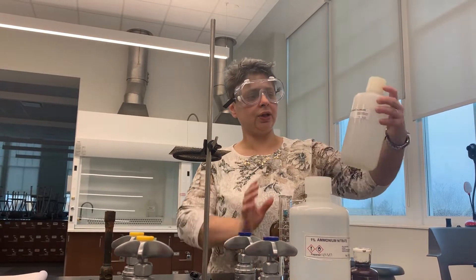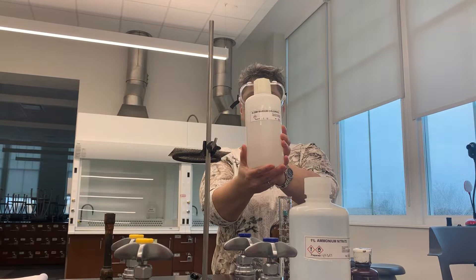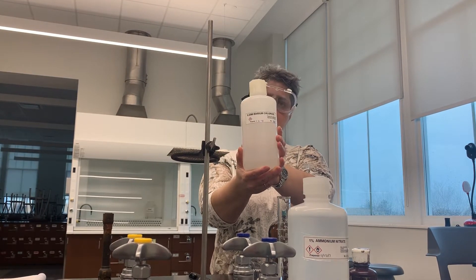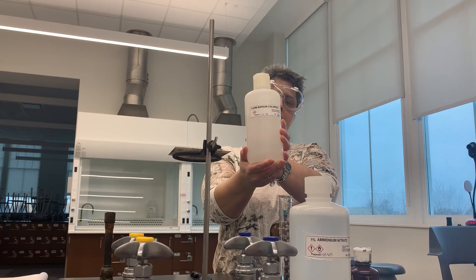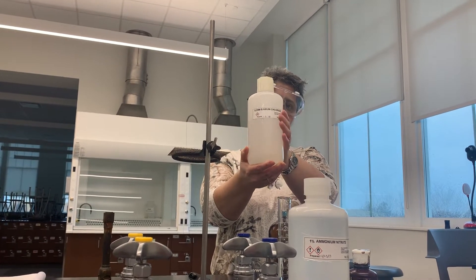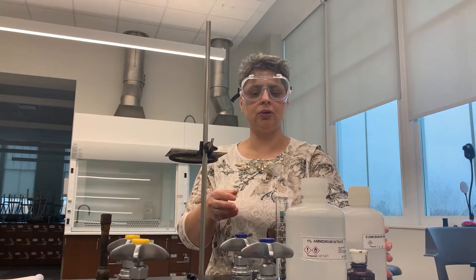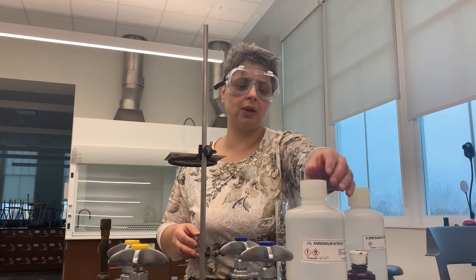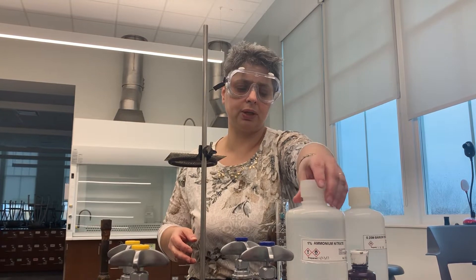In this container here I have barium chloride — 0.25 molar barium chloride solution — which will be used to precipitate our sulfate as barium sulfate. So this is our source of barium ions. There are also two other chemicals that will be employed later in the procedure that I wanted to talk about briefly now.